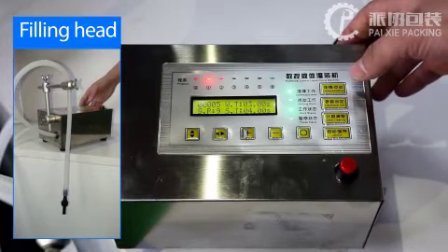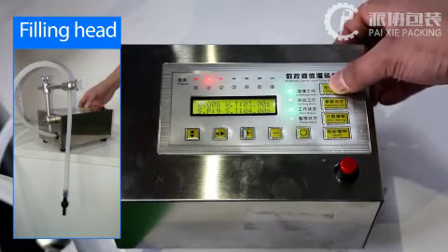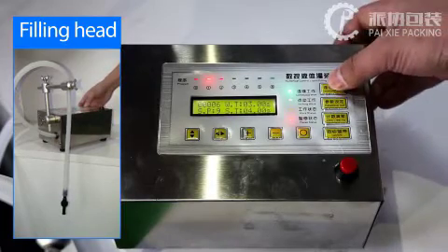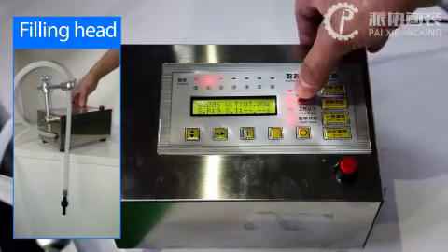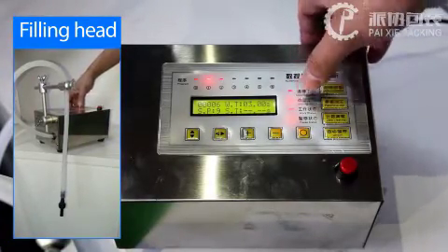Let's change to manual working. You can see the red light. This is manual working.